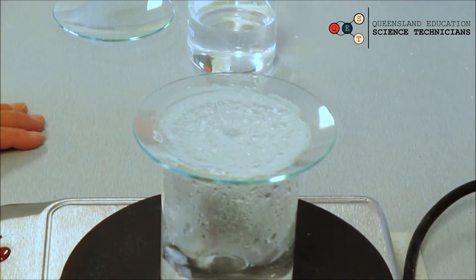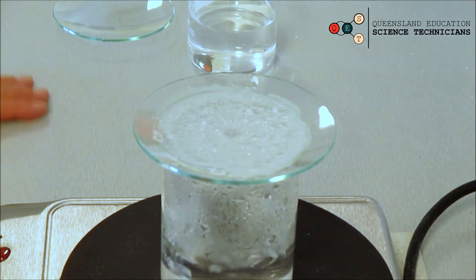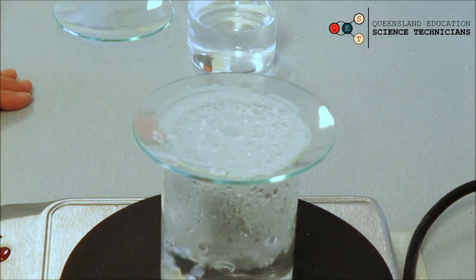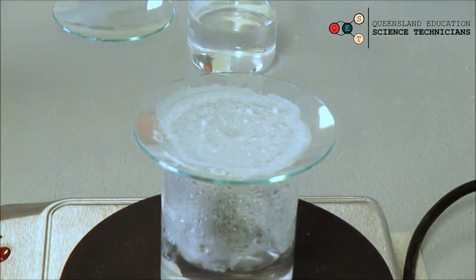Then you have to, or your teacher will, pack it away. That just involves washing the watch glass and putting the boiling chips back into your boiling chip container.